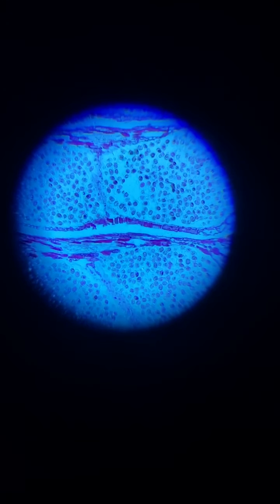Let's zoom in on this. And we need to refocus. Now you can see much more detail. We can look at the different parts in each cell. And now I saved this for last.